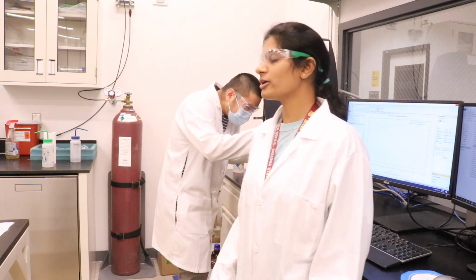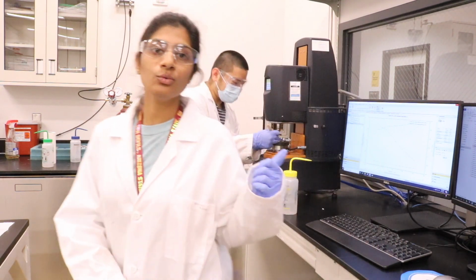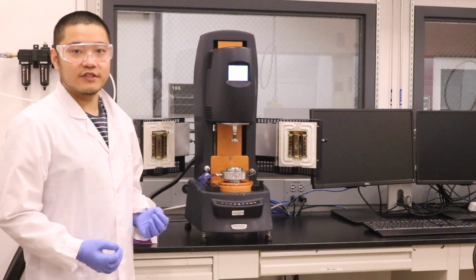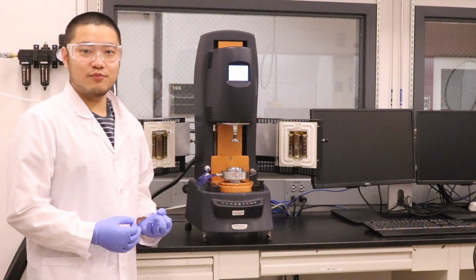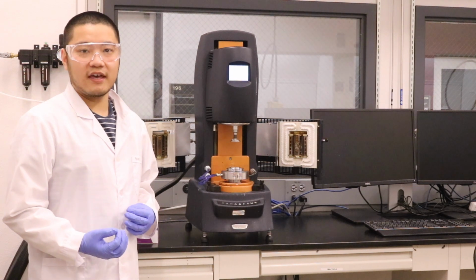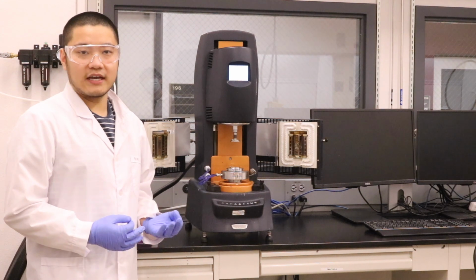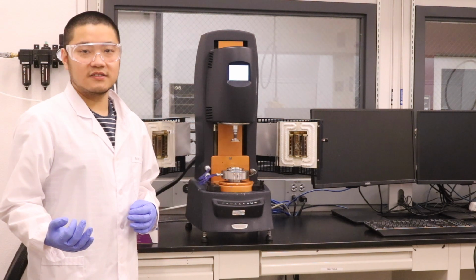As you can see, one of my colleagues is working on a complicated instrument called a rheometer. So, he'll explain what we will do with it. Rheology is used to describe and assess the deformation and flow behavior of materials. Liquids flow at different speeds, and solids can be deformed to a certain extent. Oil, honey, shampoo, and hand cream all behave differently in terms of their physical behavior. They can be put in an order. On the one side is liquid, and on the other side is highly viscous, semi-solid substances.